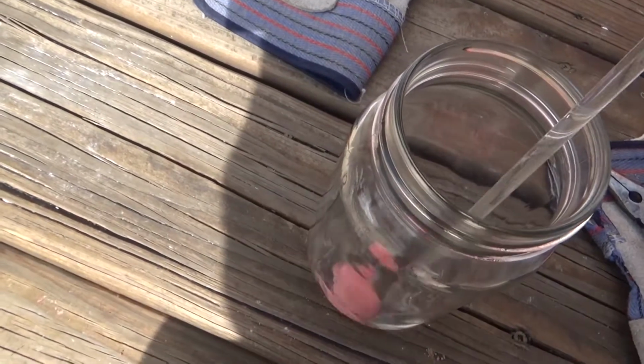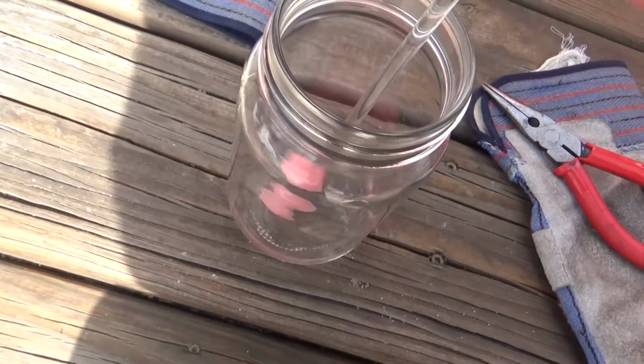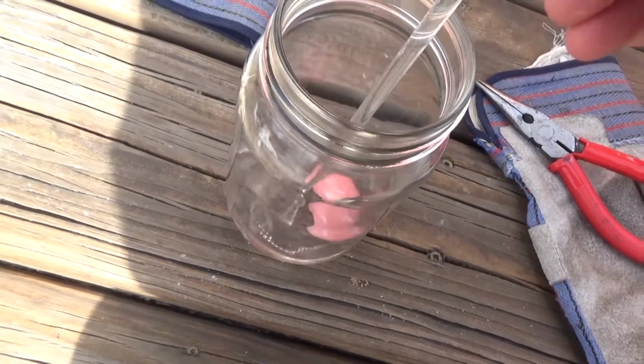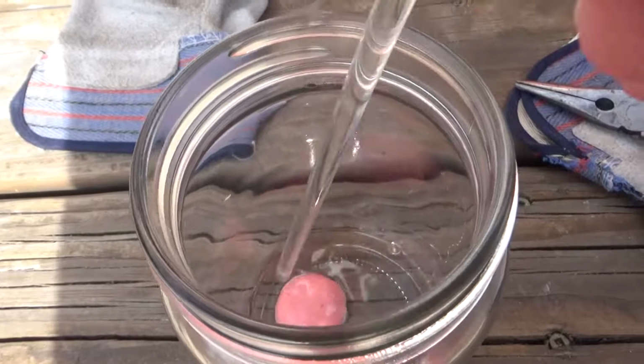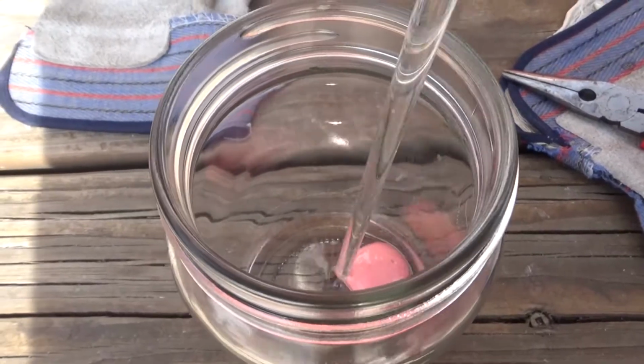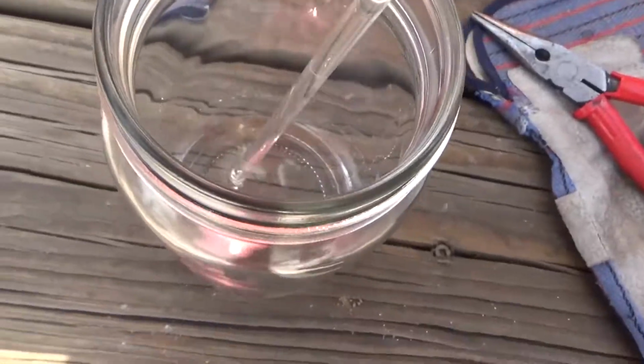It's actually doing alright. This is a test that I'm really interested in, because if I have acid in a flask, and this is stopping it from pouring out, I want to make sure it'll last, right? I'll just let it sit for a while, and I'll let you know if there's anything that changes.